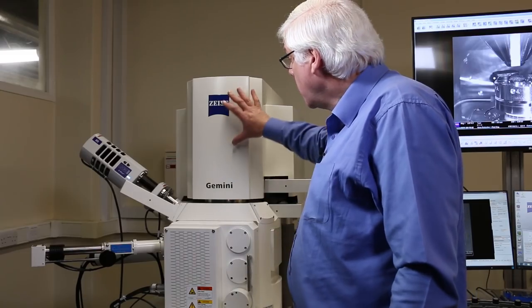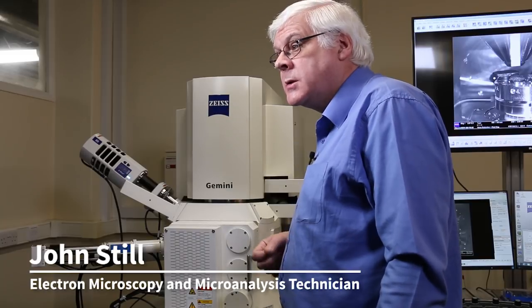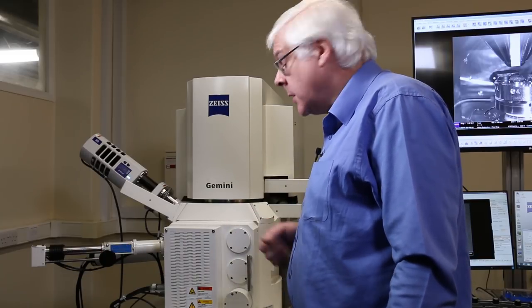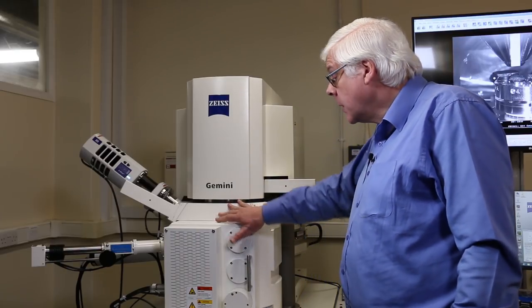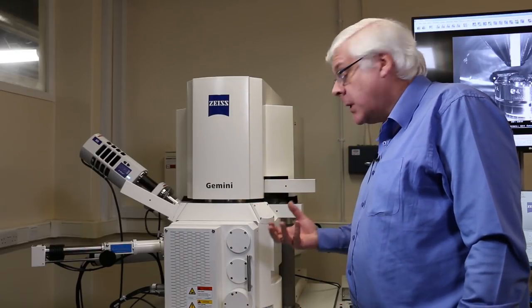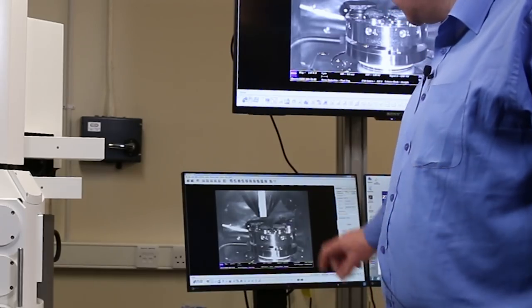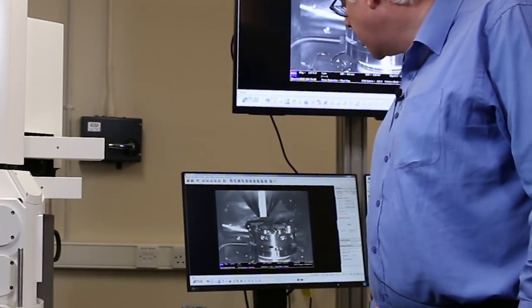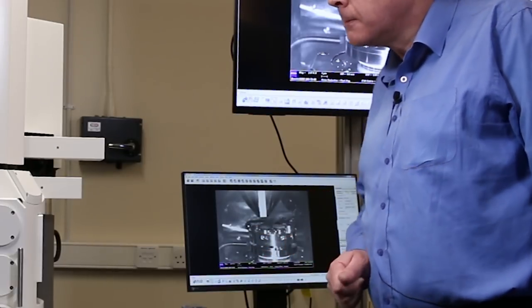At the top part of the instrument we have the electron gun, which supplies electrons used for producing images of samples. Here we have the sample chamber, which is under high vacuum. We have samples set up in it, and we can see an internal image of the chamber here showing a number of samples ready for imaging.